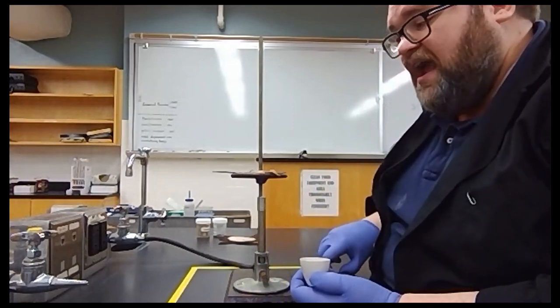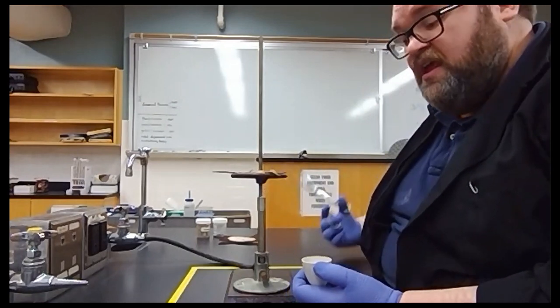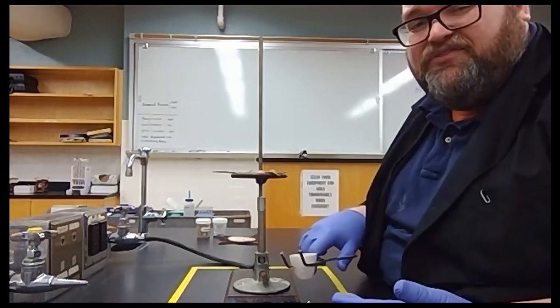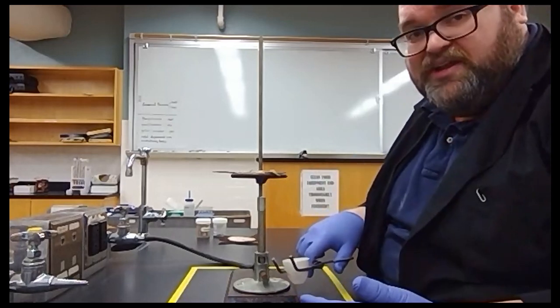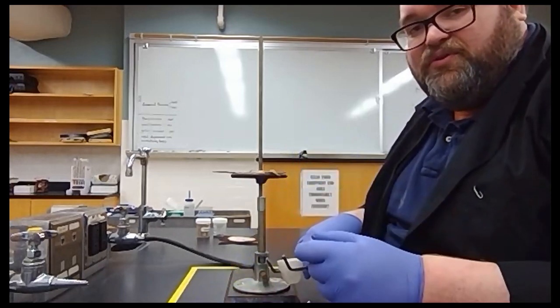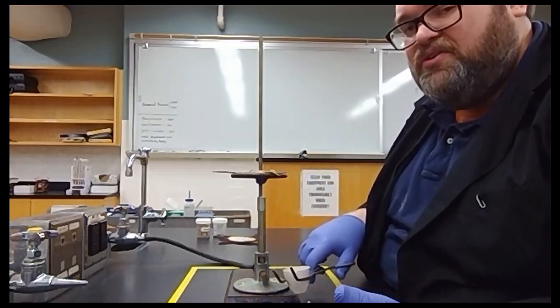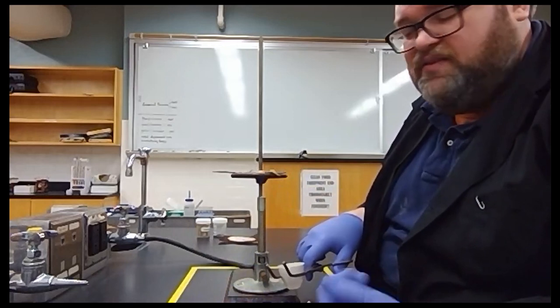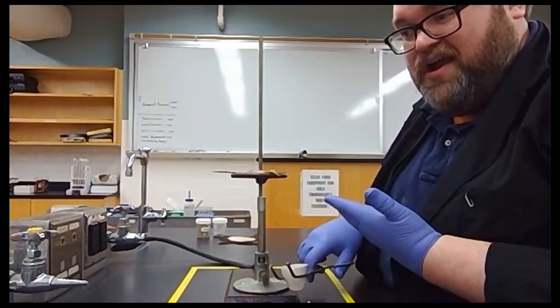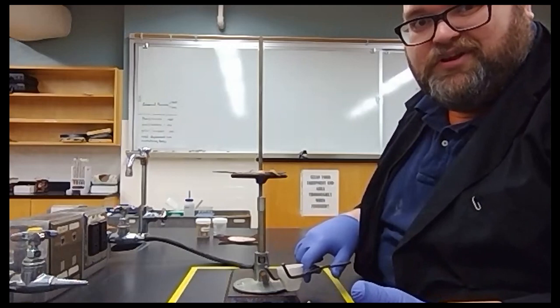So we're going to take our crucible and we're going to obtain its mass before it's burned. Then we're going to heat the crucible for 10 to 15 minute increments and cool it down and weigh it. And we're going to continue to do that until the difference in the mass of the crucible is very, very small. This usually only takes 2, maybe 3 heatings. Today, we're not going to show you all of those because that's 15 minutes on the fire and then 10 minutes to cool, a couple of minutes to weigh, then 15 minutes on the fire, 10 minutes to cool, okay?